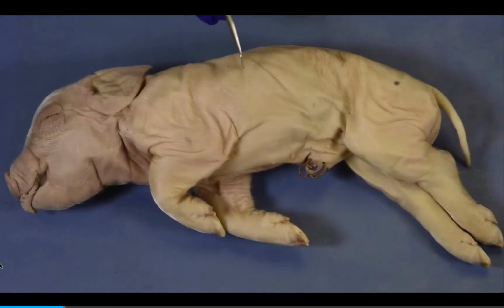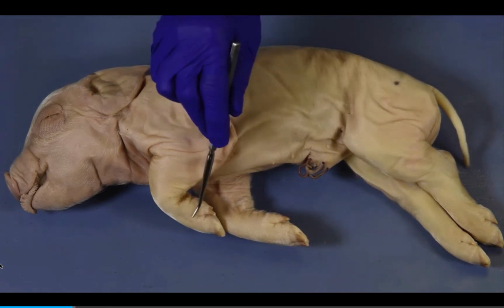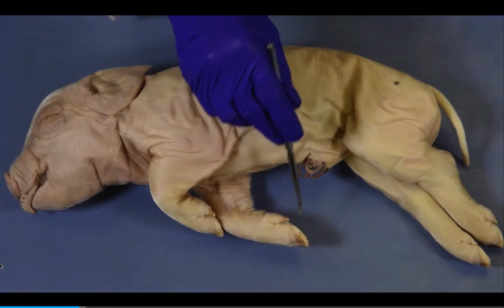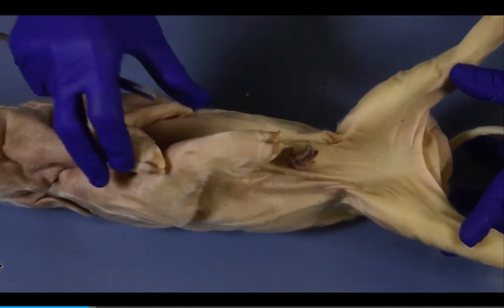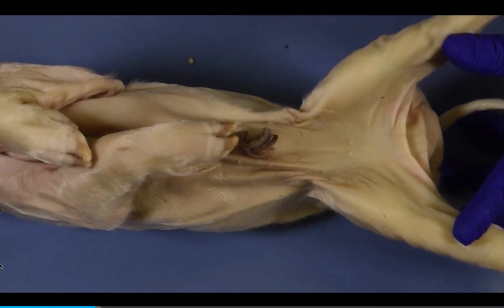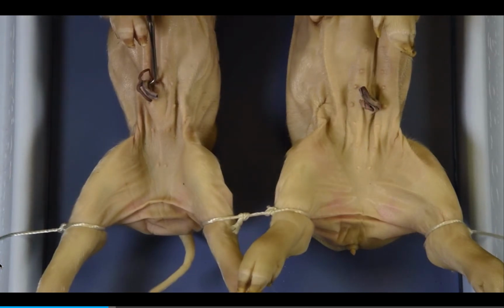The trunk includes the anterior thorax that is enclosed by ribs, posterior abdomen, anus, tail, and appendages, which include forelimbs and hind limbs. Note that the toes or digits end in hooves and that the first toe is absent. Now, reposition the fetal pig to view the ventral or front surface and examine the posterior or back region of the fetal pig. Regardless of whether you have a male or female fetal pig, you can identify mammary papilla on the ventral surface of the trunk. In females, 5 to 7 pairs of these structures are associated with mammary glands. They have no known function in males. Identify the umbilical cord on the abdomen, which attaches the fetus to the placenta in a sow.